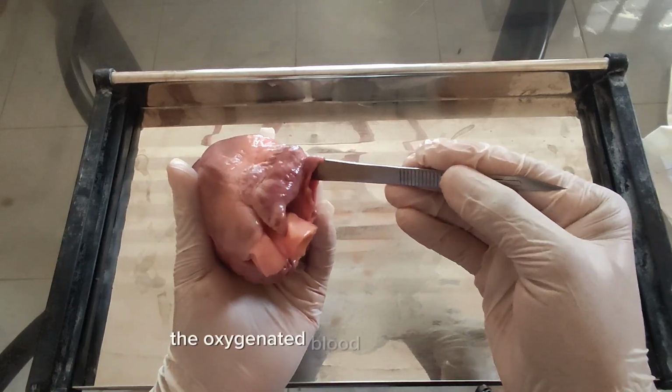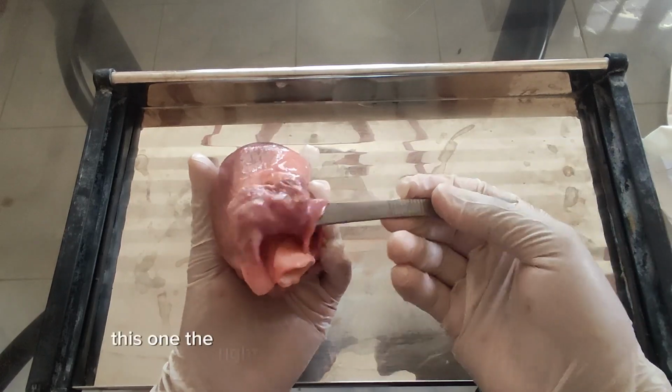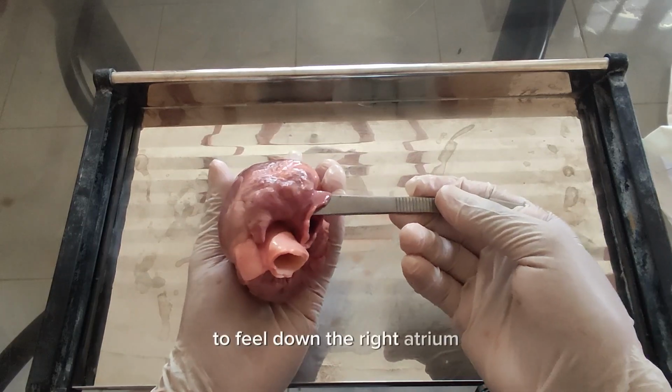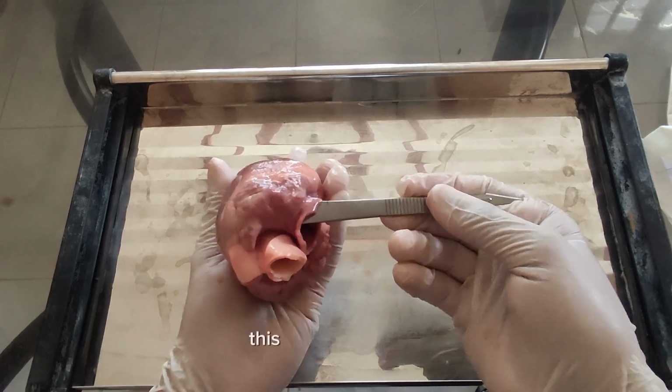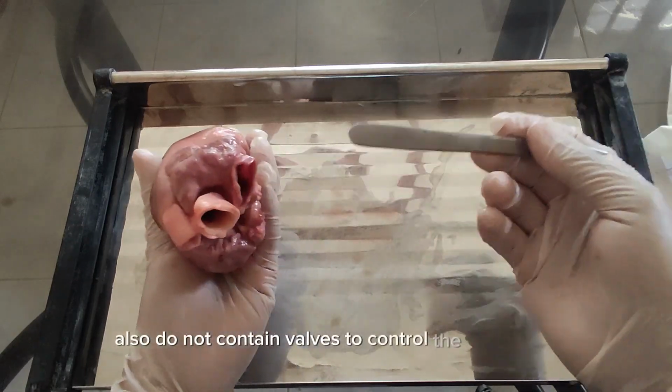The deoxygenated blood enters from the body through these vessels into the right receiving chamber, the right atrium. These vessels also do not contain valves to control the blood flow.